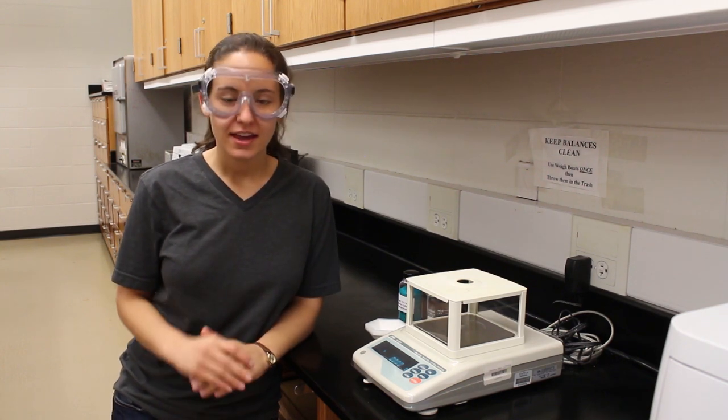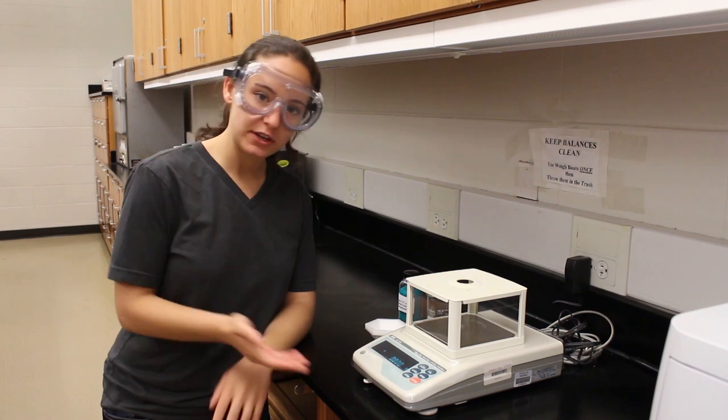Hi there, Jackie again. In the Science Lab, you'll need to take the mass of a substance, so we'll be using a digital balance.